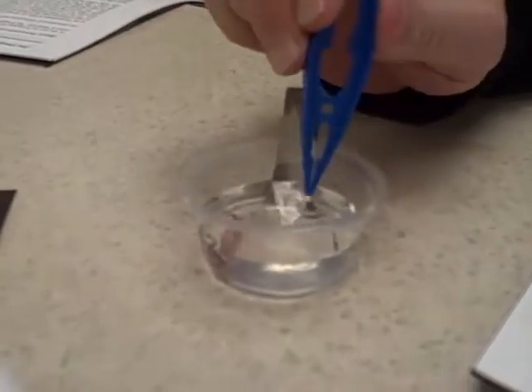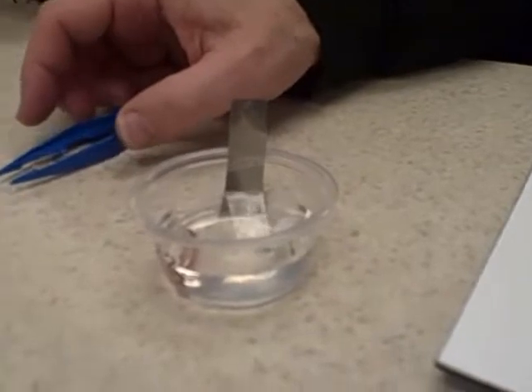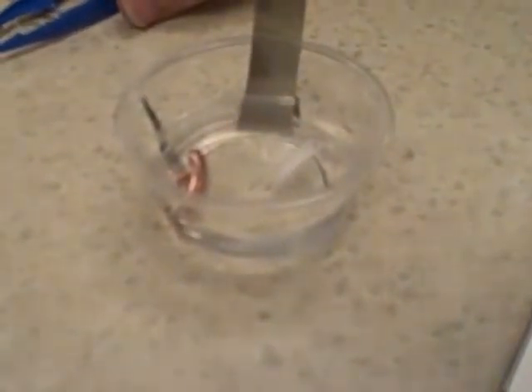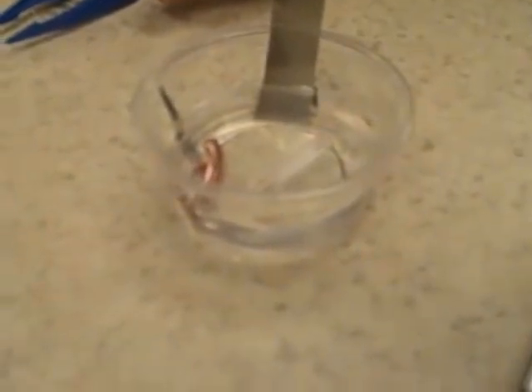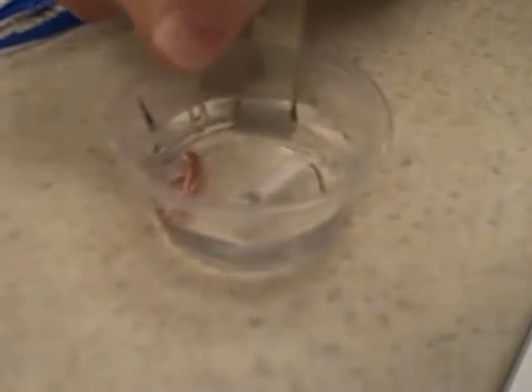And what I'd like for you to do is with each sample, remember what they are now, with each sample, see if after 30 seconds you're getting any bubbling, and rate the reaction as per the bubbling that you're getting. Rate that from 1 to 10, with 10 being the most reactive. Which metal is the most reactive? And rate them all from 1 to 10.